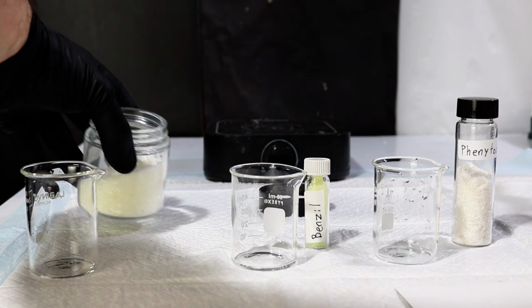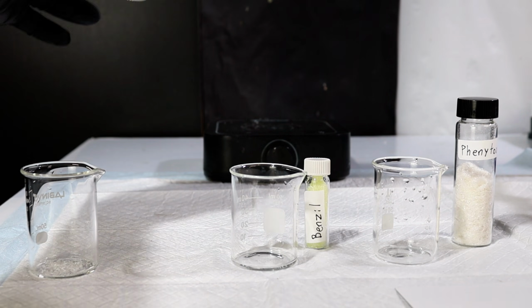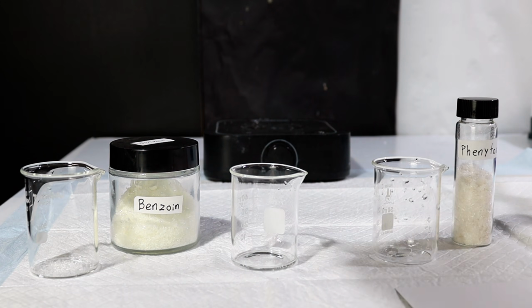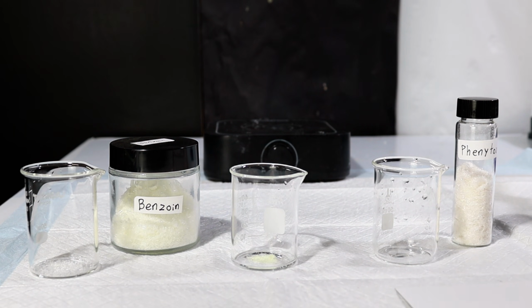Anyway, looking back at my phenytoin, I decided to try a few methods of confirming what I'd made. I first took the melting point and found that the crystals melted around 290 °C, which is a bit lower than the literature value. It was, however, way higher than the benzil I started with, which was reassuring.